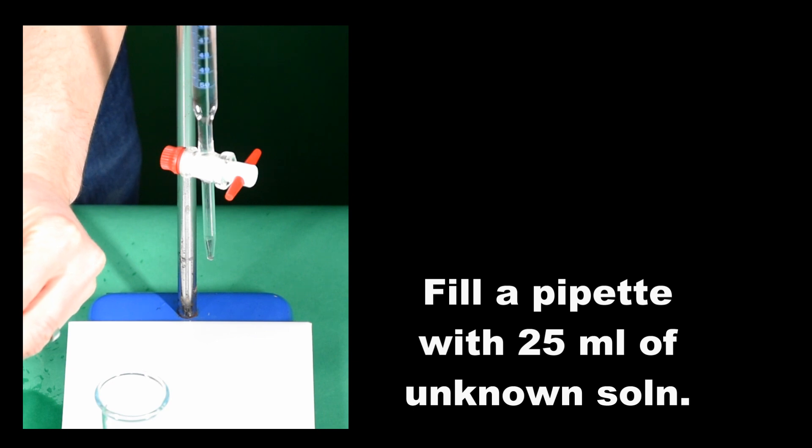Now, we need to prepare a precise amount of the alkali that we're going to test. We're going to use a pipette to pick up 25 cm³ of the alkali using a pipette filler.